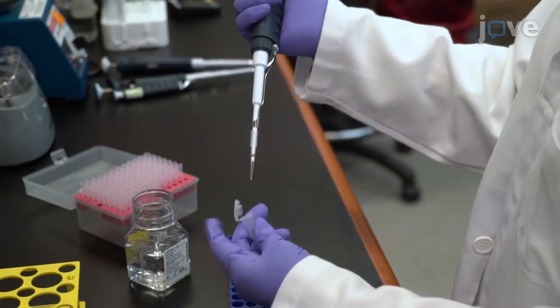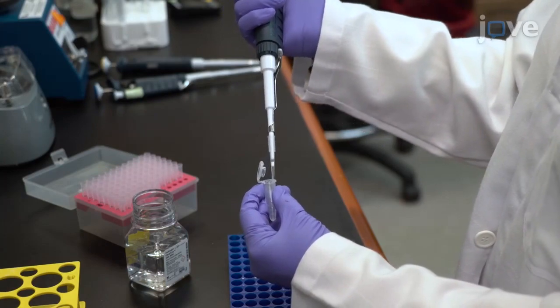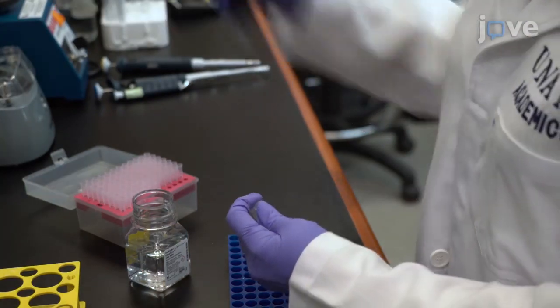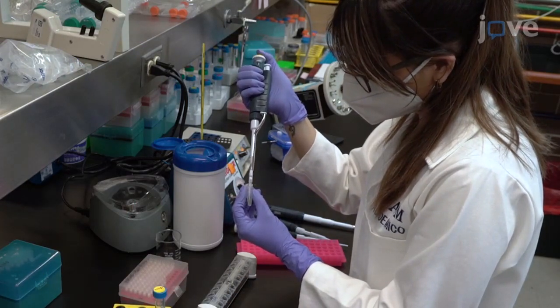During SDS and Triton treatment, disaggregate any nuclear clumps by pipetting, as aggregates interfere with enzymatic reaction efficiency, and be sure to perform the appropriate quality control measures prior to sequencing.